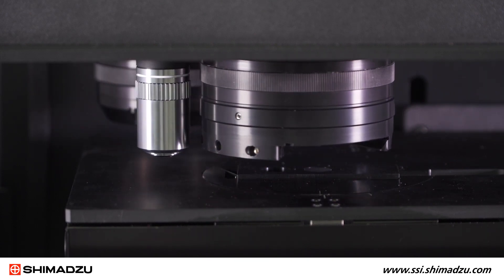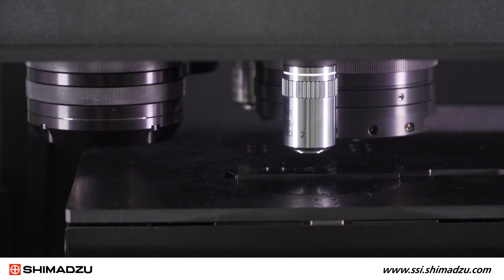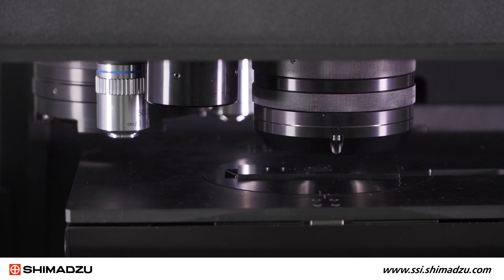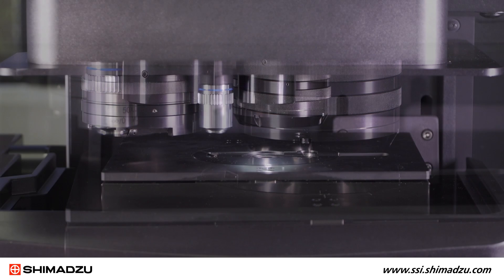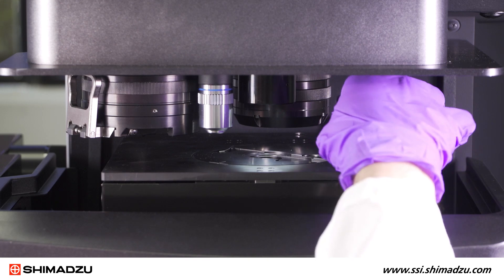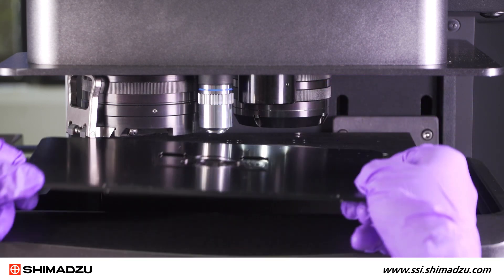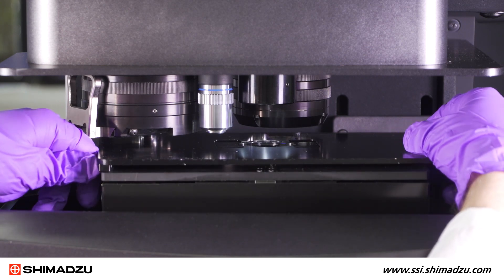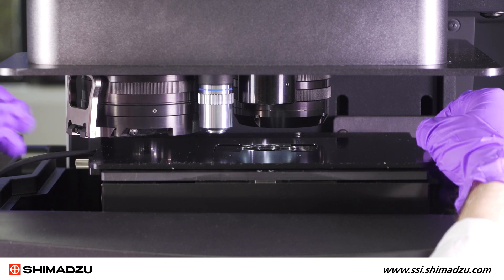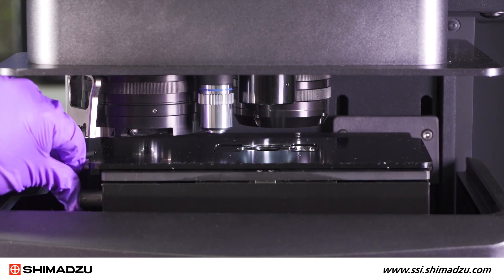There are 50x and 100x magnification objectives available for Raman measurements. There is also an optional objective for grazing angle measurements with FTIR. For micro-ATR measurements, the ATR is mounted directly to the 15x reflectance objective and a pressure sensor is mounted to the measurement stage. The pressure sensor will monitor the pressure on the germanium ATR, allowing for automatic ATR measurements to be made without damaging the crystal.